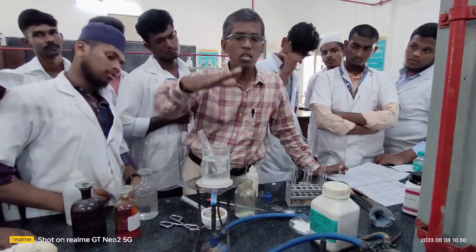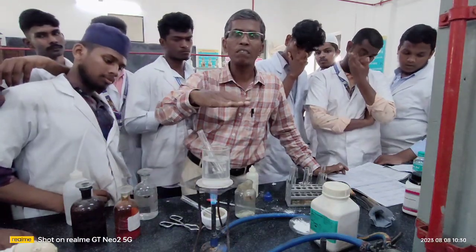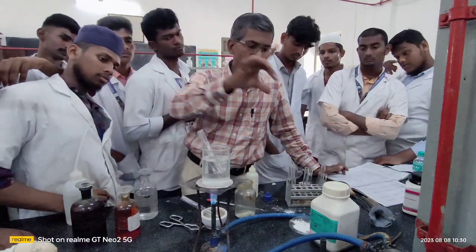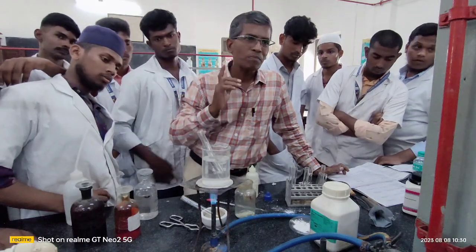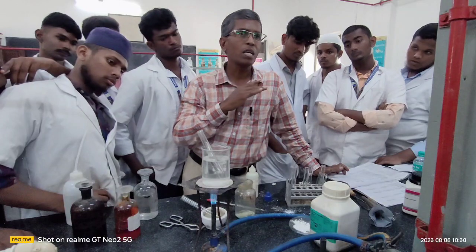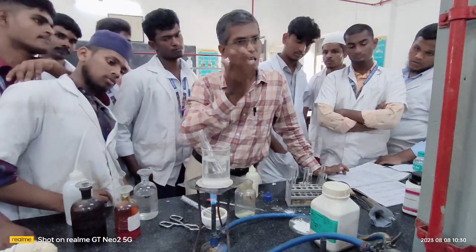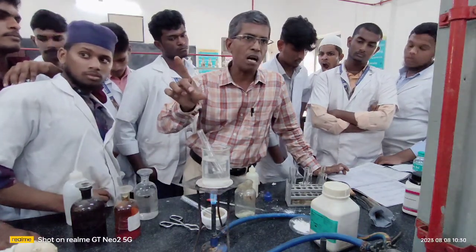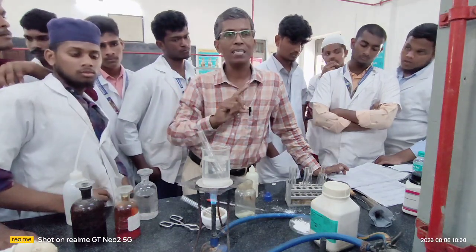Maintain it at 80 degrees or 70 degrees for at least 10 minutes. After 10 minutes is over, you take this and keep it to cool down. Once it has cooled down, you can see a beautiful formation of silver mirror on the surface of your test tube. This confirms the presence of carbohydrate, and also the presence of aldehyde.